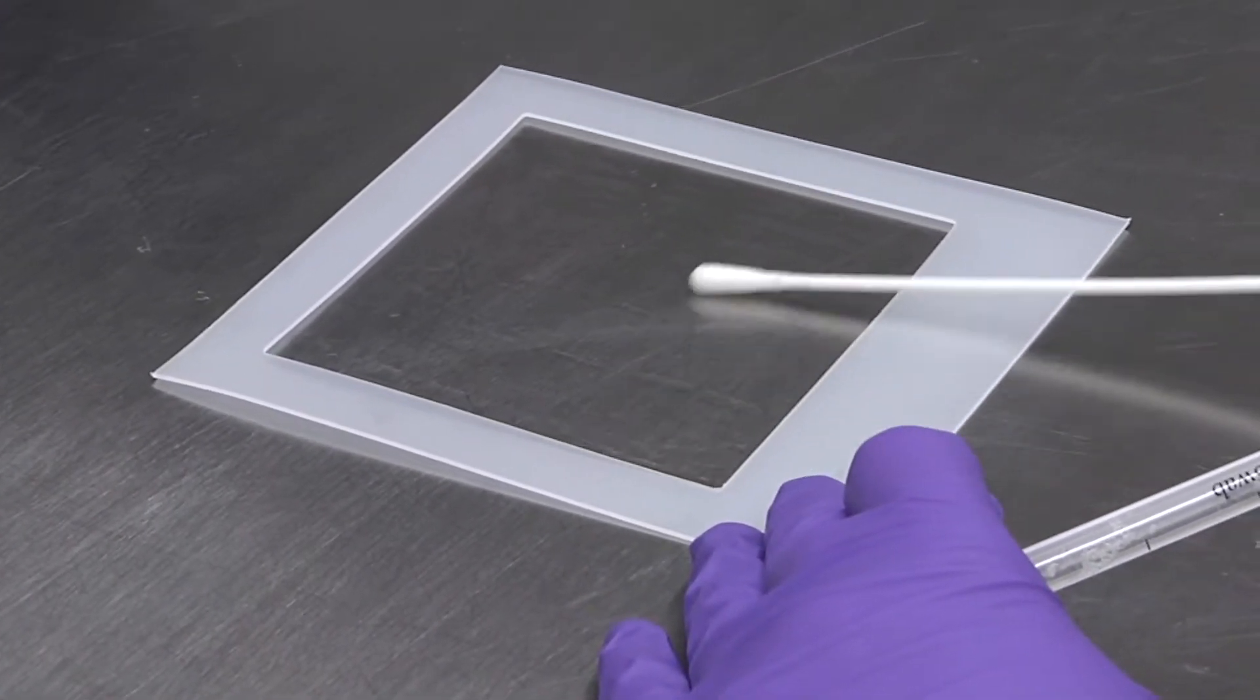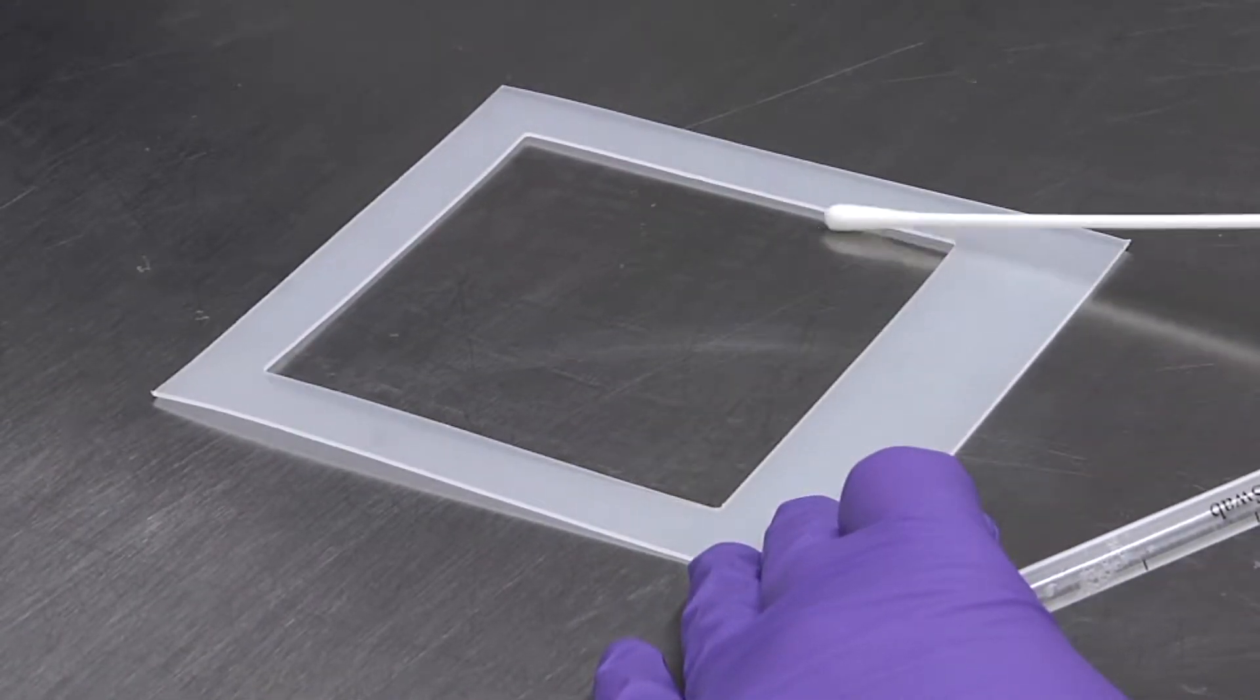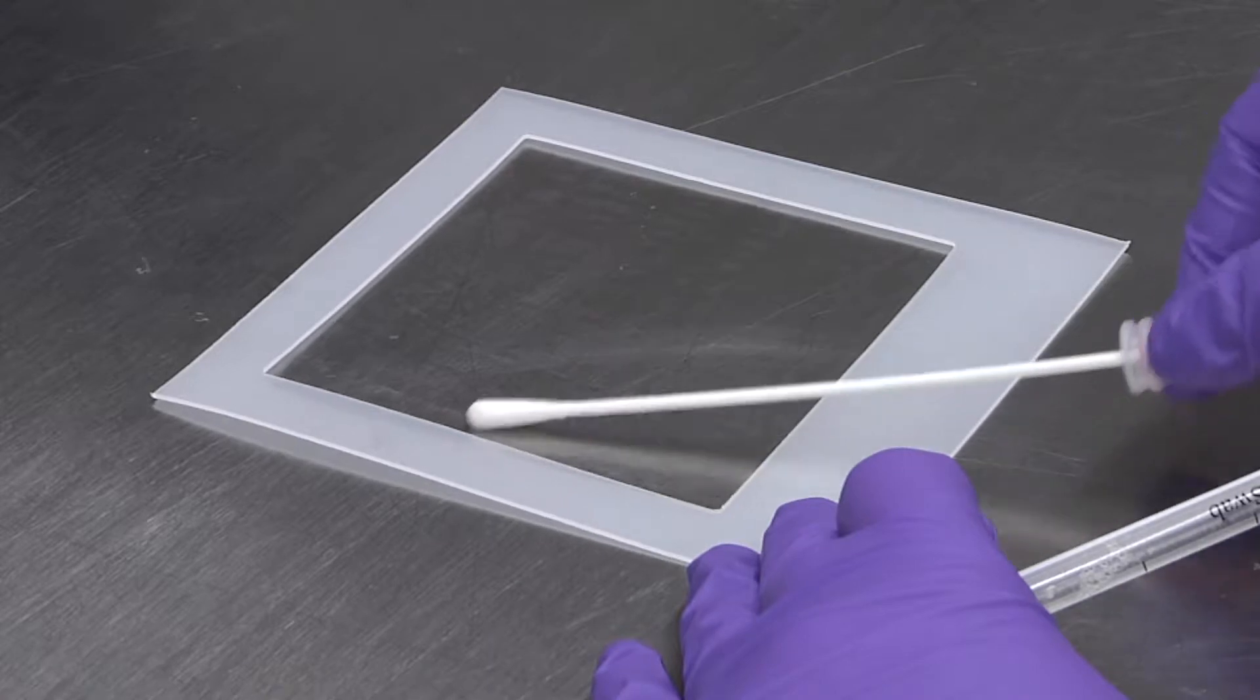It is important that you do not touch the swab's surface. Any contamination from your hand will get onto the swab and then give a false reading.